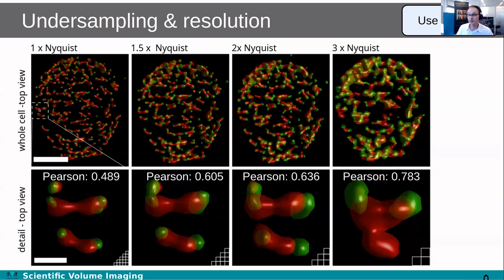This picture shows an image that we'll be looking at more today. What you see is a cell undergoing mitosis, and the red is the chromatin bridge and the green is the kinetochore complex. The chromosomes are all rolled up, and they are about to be pulled apart, the two copies of the DNA for each chromosome. That's the detail that you can see here. And this one has already been pulled apart.